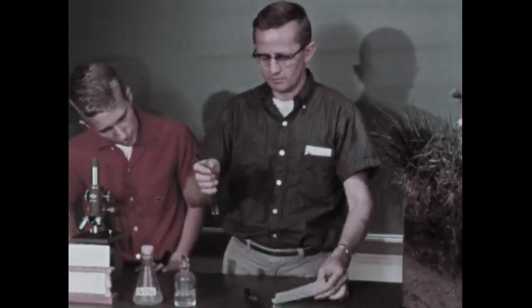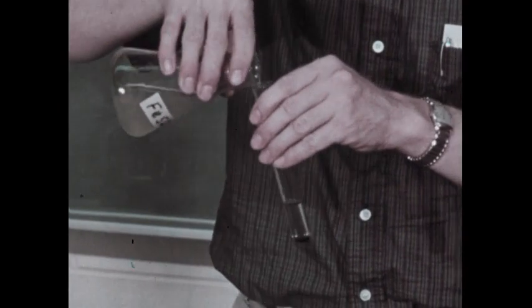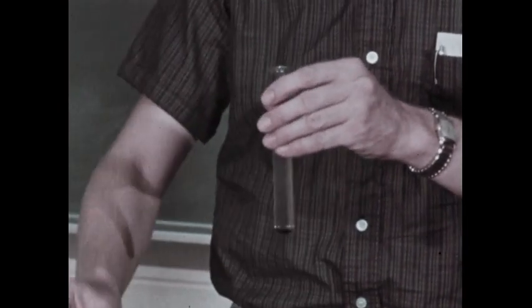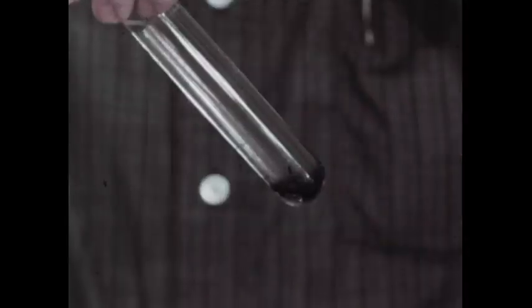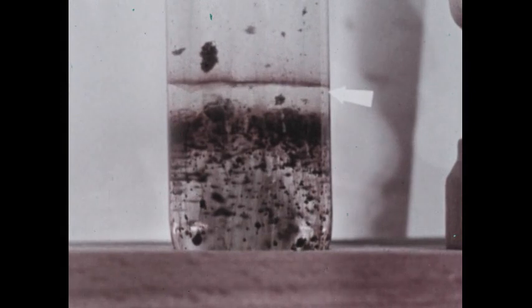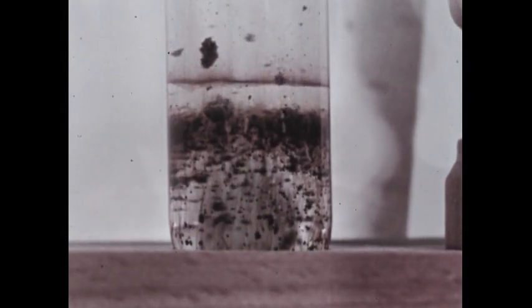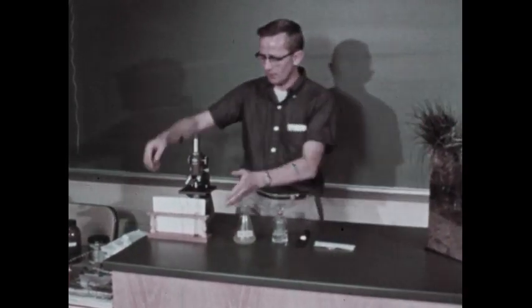Chemists test for nitrates in humus in the following way. Some humus and water are mixed together in a test tube. Then an equal volume of ferrous sulfate is added. Now, holding the test tube in an inclined position, concentrated sulfuric acid is added. At the junction of the acid and the other solutions, a brown ring forms. This, as chemists know, indicates that the humus being tested contains a nitrate. So we found nitrogen in the soil, a chemical converted into nitrates and used by plants.